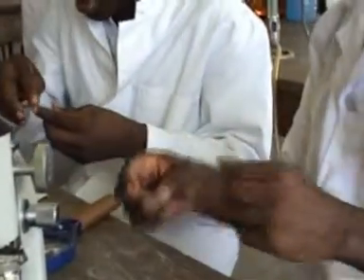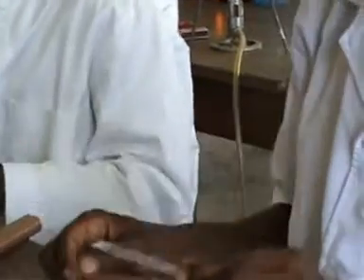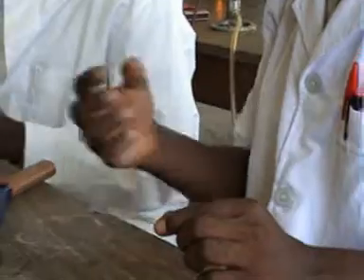So it draws up the water, and then as it is drawing, you realize that the cover slip now becomes very firm on the specimen. So the advantage of drawing up the fluid which we use to irrigate our specimen is that it also reduces the bubbles, because when the air bubbles are trapped together with the specimen and you mount it, you will see bubbles and you will be thinking that these are cells, but these are only bubbles that are there.